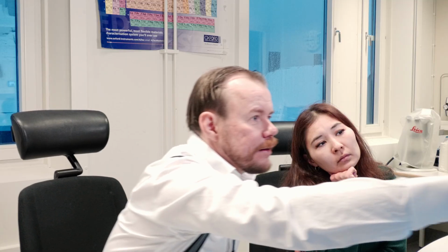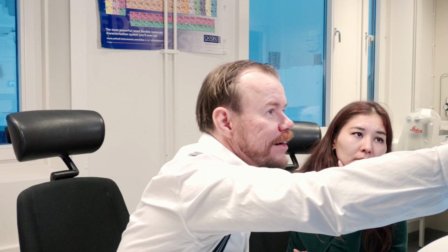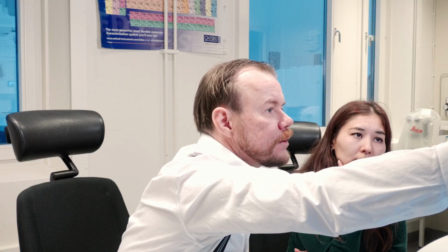It's also nice that if we look here on the scale, it's 10 microns here. And we see that the silicon particle is about 10 microns. We measured 14, I think. And your mark is about 2 microns from the edge of the silicon particle. And we see we have a little bit of silicon signal there.